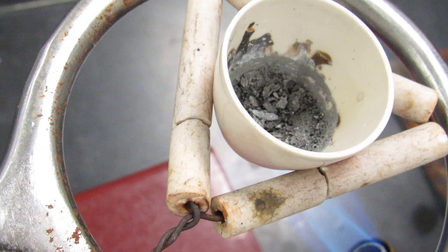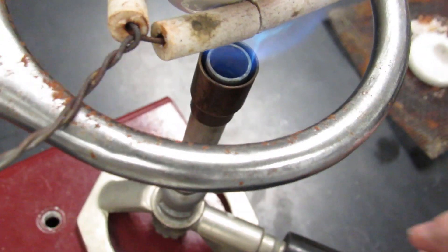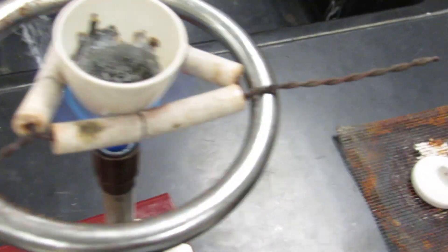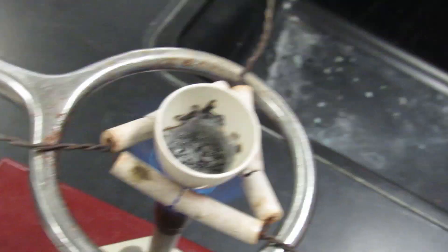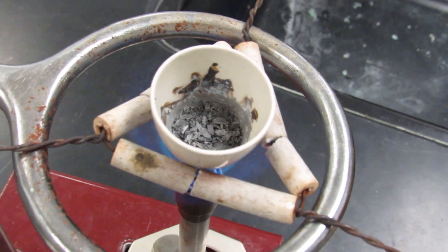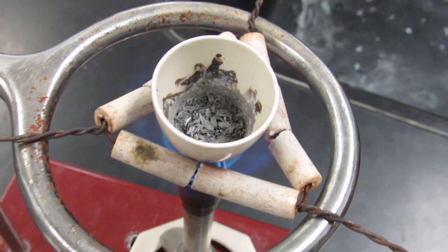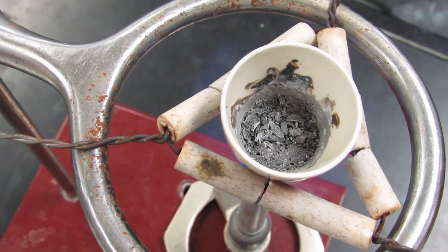And then if there's sufficient time in class, you're going to do it a second time, the water step. But if there isn't sufficient time, you're going to go ahead and mass it after this step. Ideally, you'll do a massing before the water step and then you'll do two water steps.